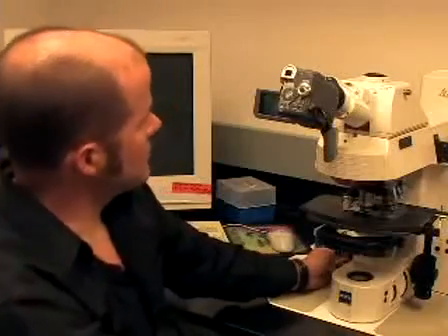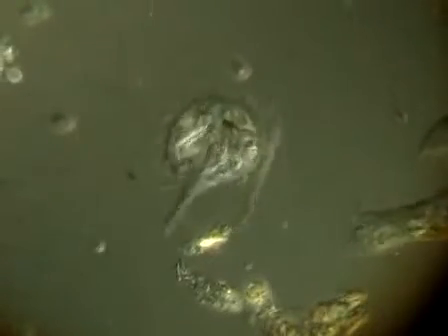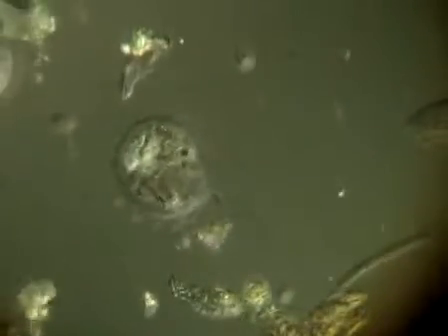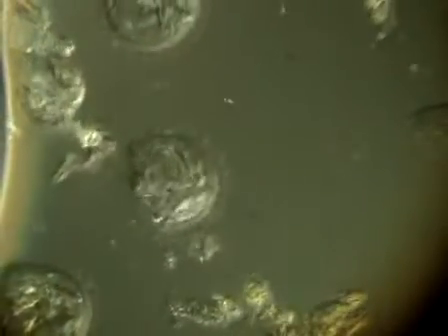This is Trichomitopsis. This is the only termite gut protozoan that's ever been cultured and studied in vitro. There were about 3 or 4 papers on this protozoan 20 years ago, and then the culture was lost, and no one has ever been able to culture it again. But these studies established that protozoa will ferment cellulose and xylan, which are the pentose and hexose polymers in wood, and produce as products acetate, hydrogen, and CO2.